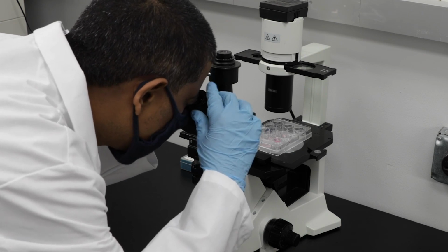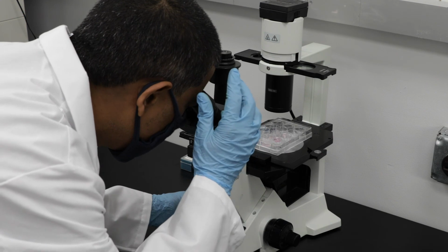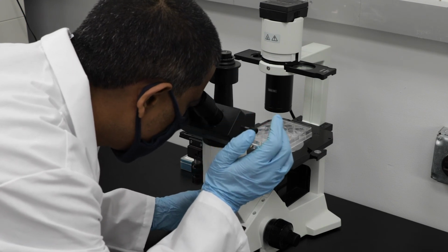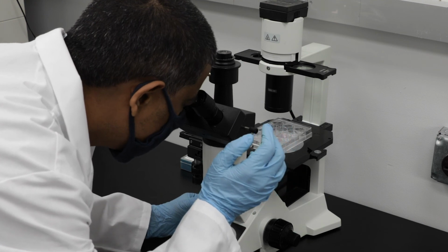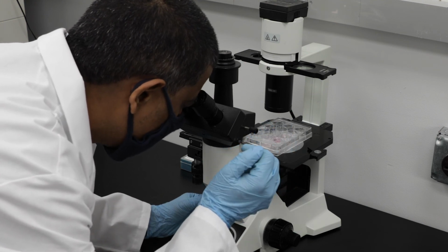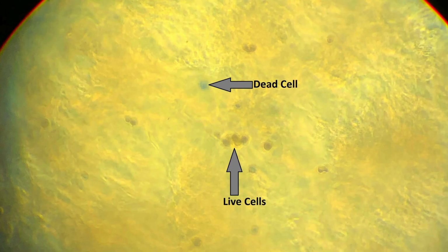So sort of like if we had 10 live cells, we could say 10 live cells per square millimeter. If there are 3 dead cells, 3 dead cells per square millimeter, and so on. And then average those out across the 4 sections, and then we can average those out across the 3 samples per group. So here's a picture of what the live dead cells look like under a microscope. This concludes session 4.